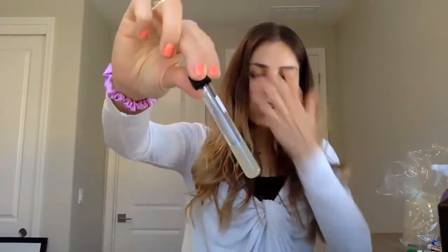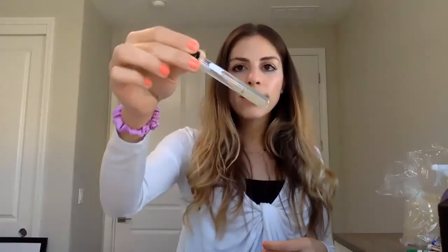Okay, and the way we're going to do this experiment is I grew bacteria here, so your subculture has bacteria growing. I want to take this bacteria and grow it on these 4 plates with various sodium chloride concentrations. Then I want to incubate it and come back and see this bacteria, is it able to grow on high salt concentrations? Because I already know it can grow on nutrient agar. I just want to see, will it grow on high salt concentrations?